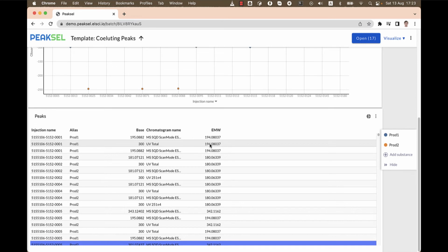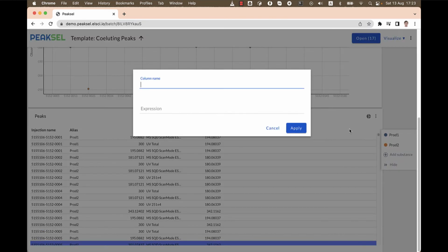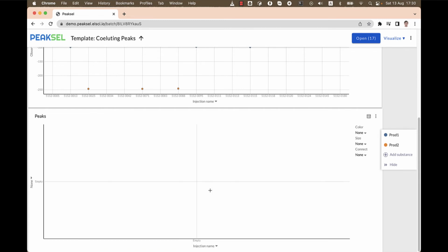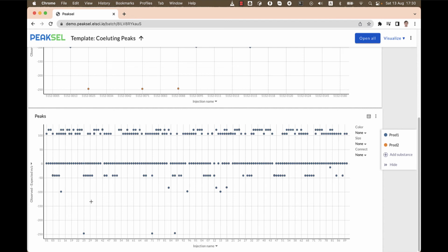And in order to see the difference more clearly, I'll add a calculated column and subtract one value from another. I'll call the column observed minus expected m over z, and we'll enter the mathematical expression. We can see the newly created column that holds the difference between the two others. Now I'd like to plot this difference. I'll choose it as one of the axes. As you can see, there are plenty of values that are close to 0. This is our 1 Dalton difference because of the hydrogen. But there are plenty of other values that are different. Seems like there are too many of them, so something must be wrong.